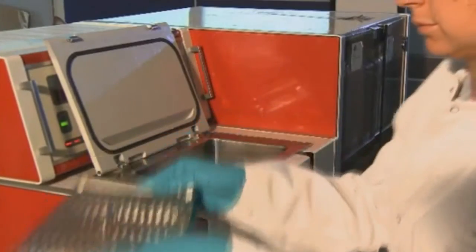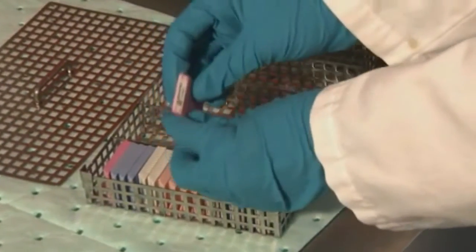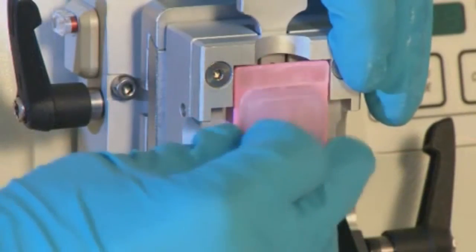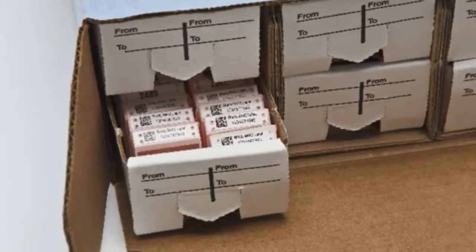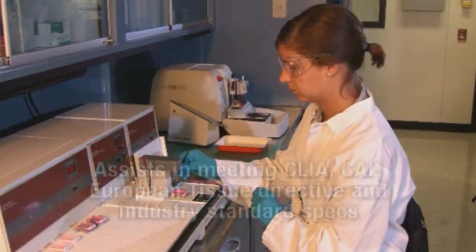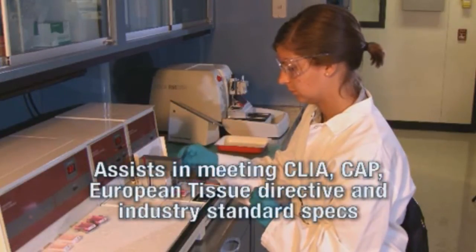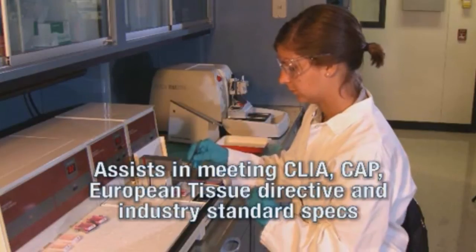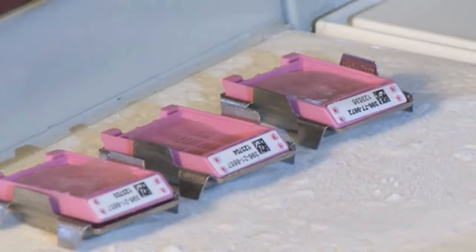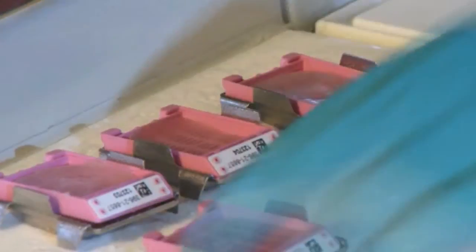The unique rivets hold the labels in place through each step in tissue processing — fixation, embedding, sectioning, and long-term storage and retrieval. The B482 tissue cassette labels with R6400 ribbon are specifically designed to withstand most tissue process protocols without smearing or fading. Labels remain attached, clear, and legible, resulting in significantly fewer identification errors.